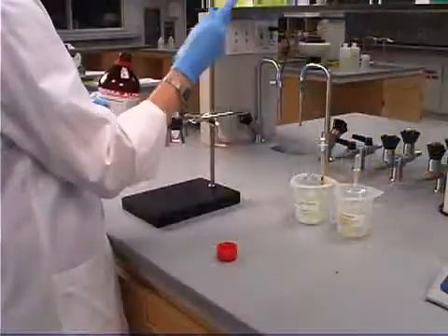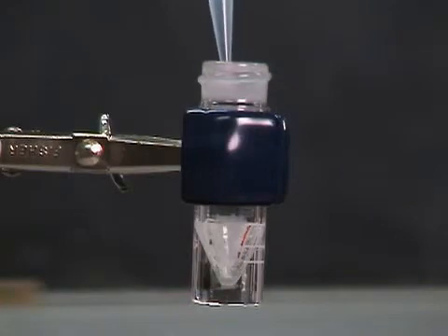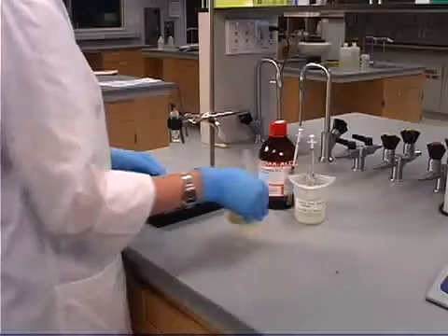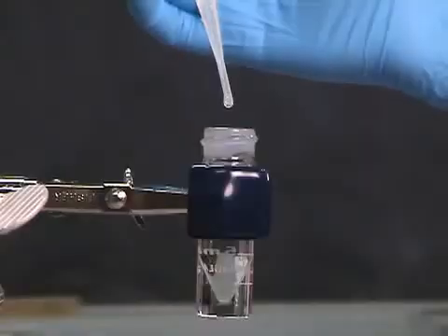Let's start by adding our reagents to the vial. Add the carboxylic acid and alcohol, followed by one drop of concentrated sulfuric acid as the catalyst.